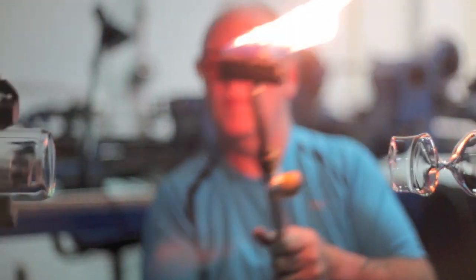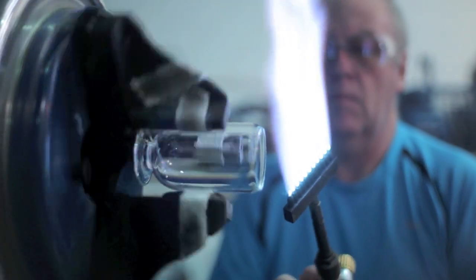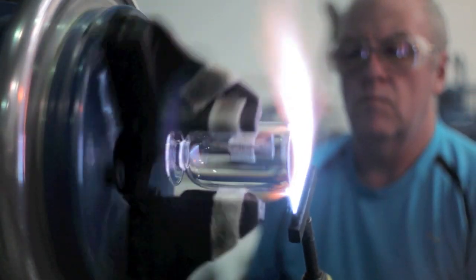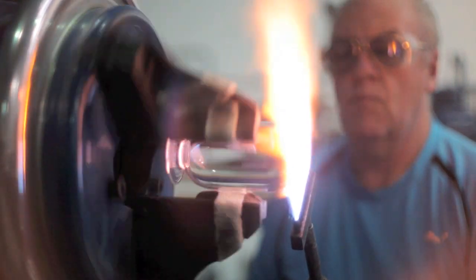Now we go to the flange. So I will heat that. It will travel back a few millimetres on its own back to the china graph mark which will give an overall length on the beaker.